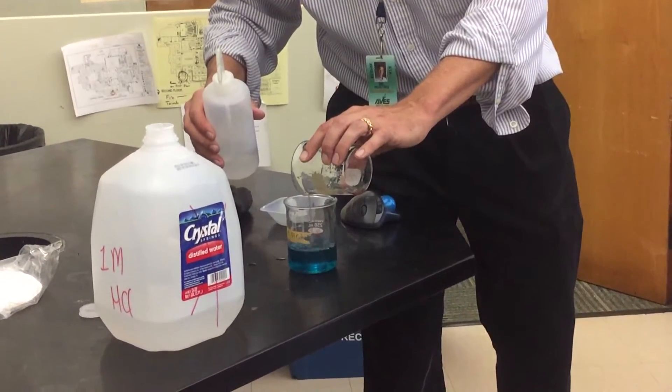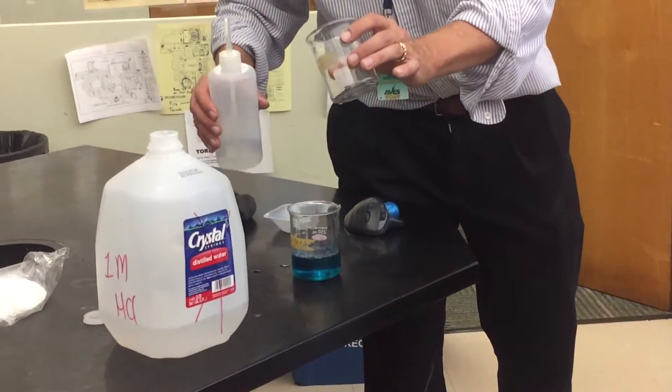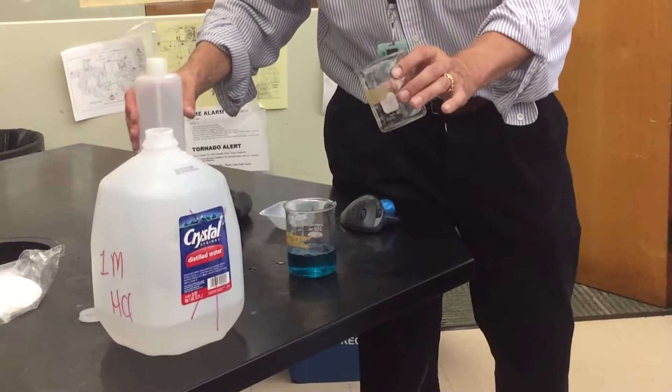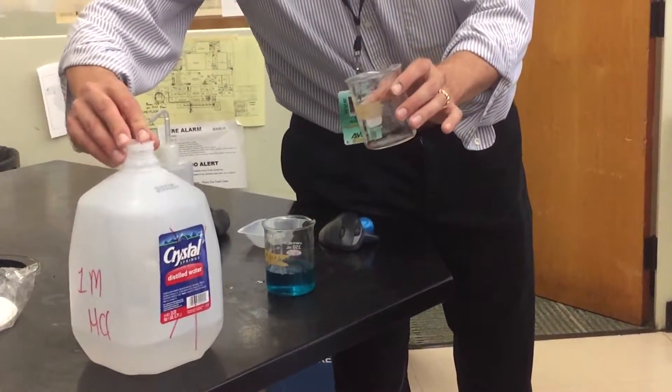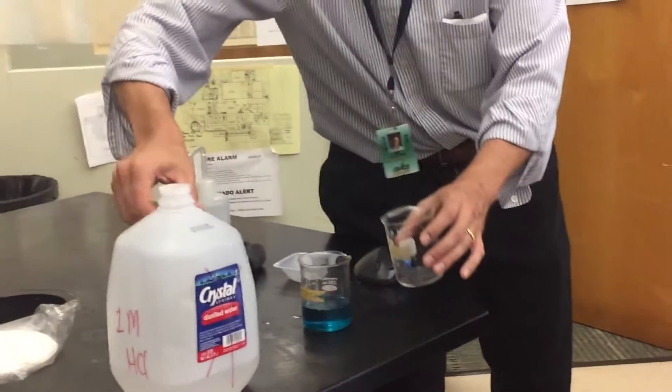And then basically what we have left, guess what? Nice, clean copper. So do you think the mass of this copper is important? Yes. It is. So we need to get that, so now we're going to filter.